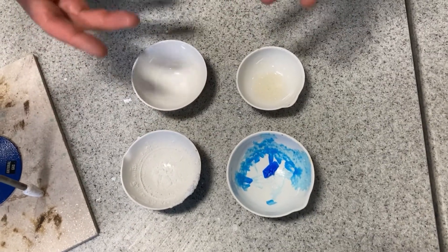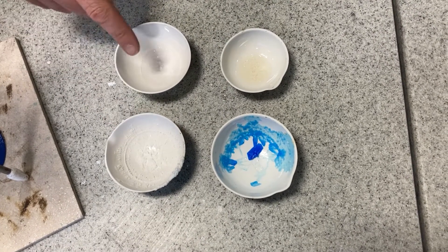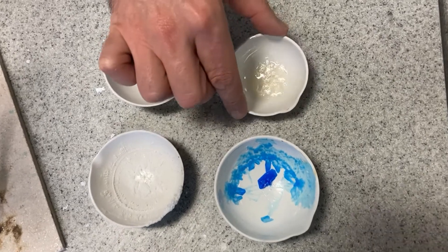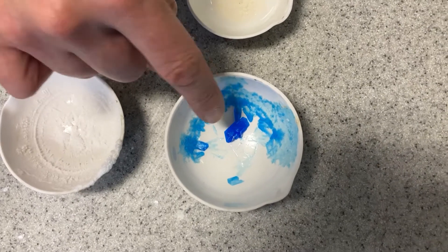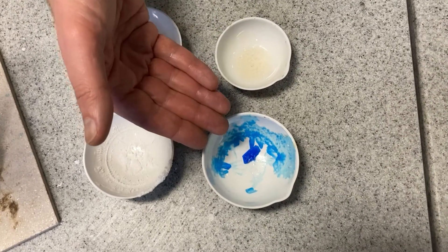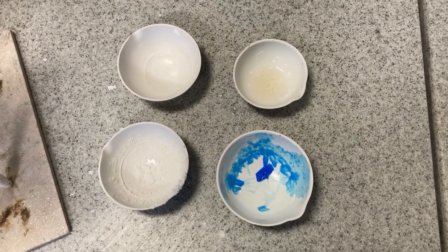So here are the ones that went through the filter — I left these the other day. We've got the salt, the sugar, and the ammonium chloride, though I've forgotten which one's which. That one's not quite dried out yet — I think that's the sugary one. This one though is the nicest looking: the copper sulfate. The blue liquid went through the filter, and you could clearly see something in it. Now that the water's gone, we're left with these lovely crystals. They're not worth much money but they are very poisonous, so we'll dispose of that correctly.